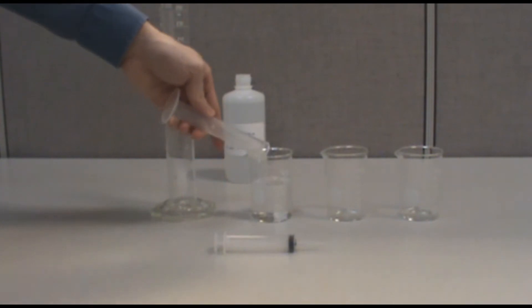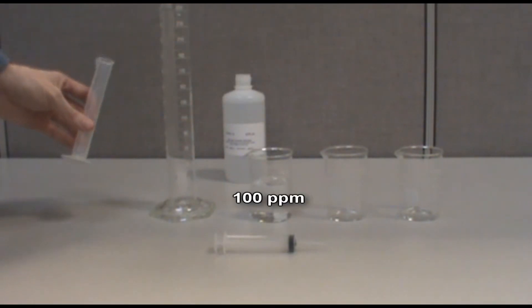This will be your 100 part per million standard. You may want to label each standard as it is made to avoid confusion.